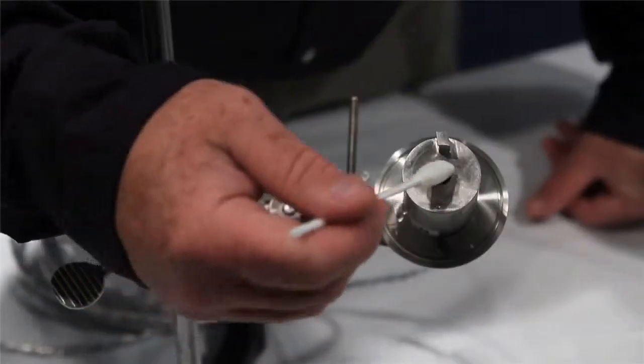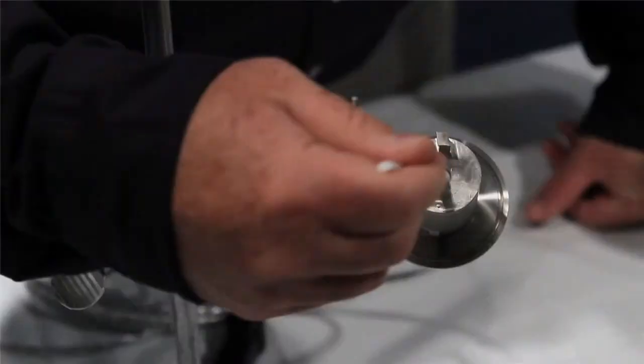Step 4. Use clean, foam-tipped swabs to scrub the measurement chamber clean.